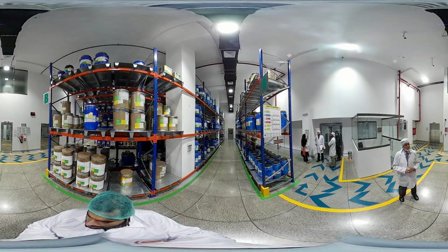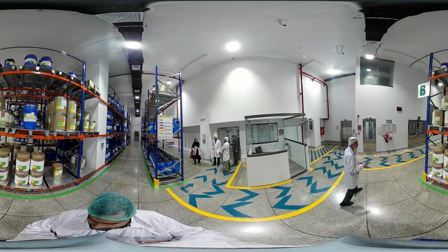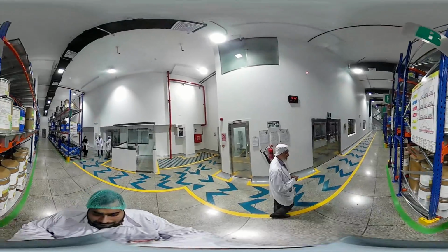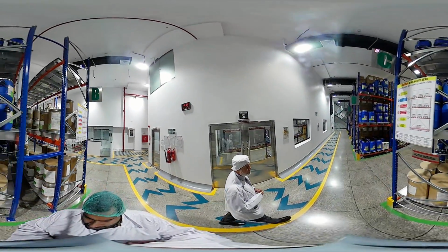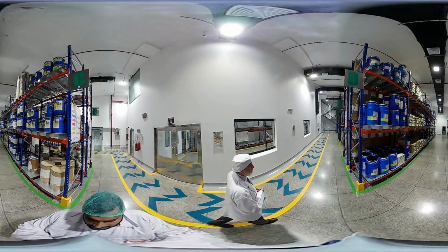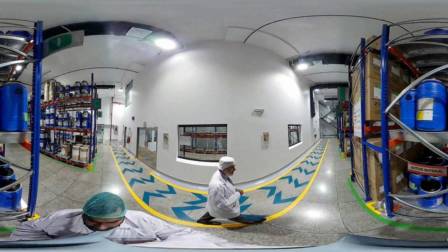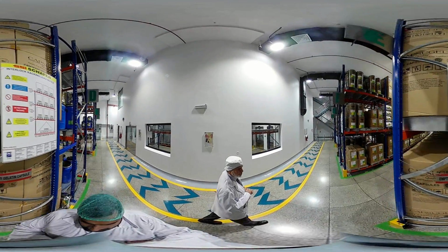One thing I also want to explain: whatever materials we procure for this store come from validated and qualified vendors. We have a complete SOP on how to validate and qualify our suppliers and vendors, especially for raw materials, excipients, and most important, the API, active pharmaceutical ingredient.